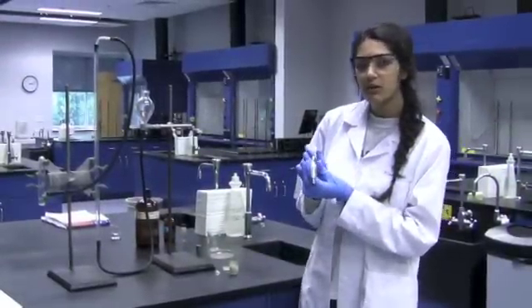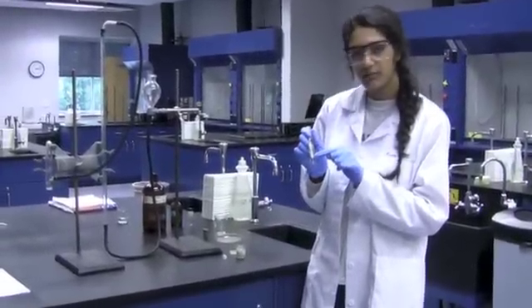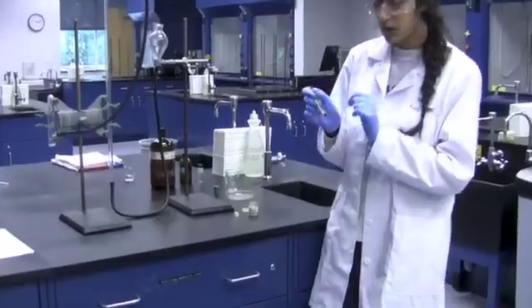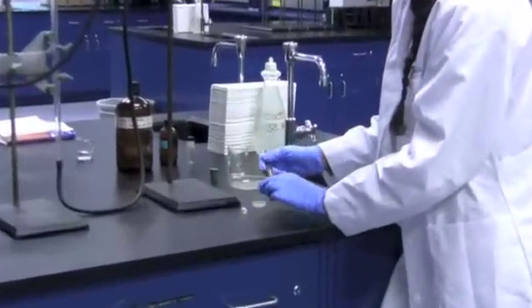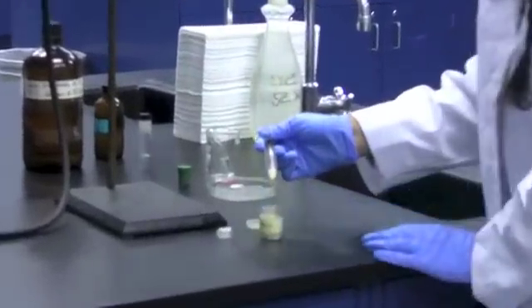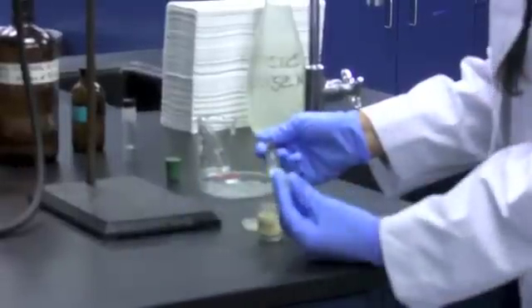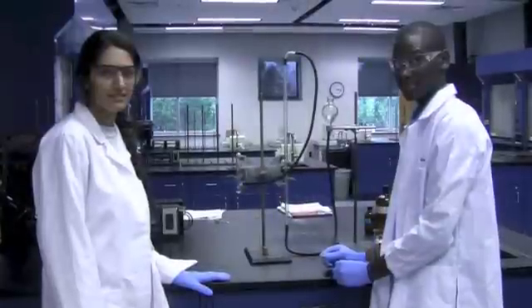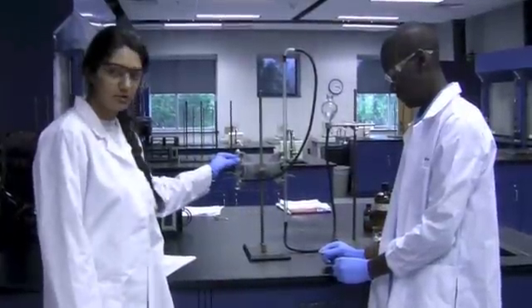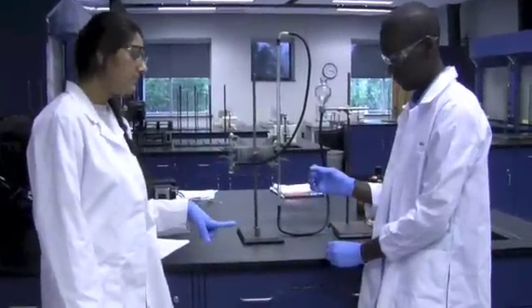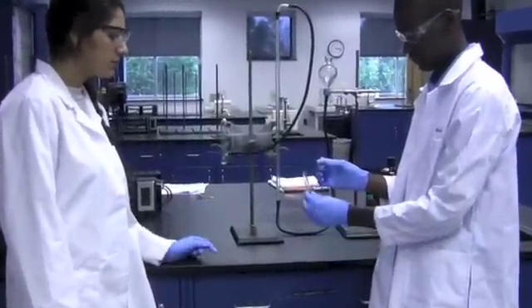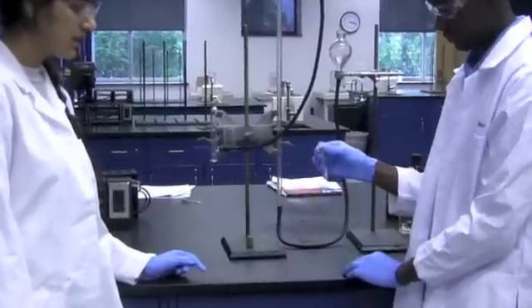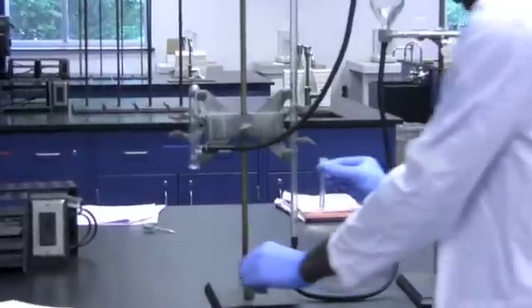You'll be provided with a metal spatula that is covered in black ink at the very tip. You want to take enough yeast to cover that tip. Then take the plastic cup and put it inside. Holding the sidearm test tube, you want to take the plastic cup that contains yeast and place it on top of the culture tube containing H2O2, followed by the rubber stopper.